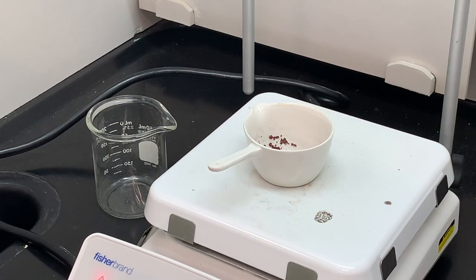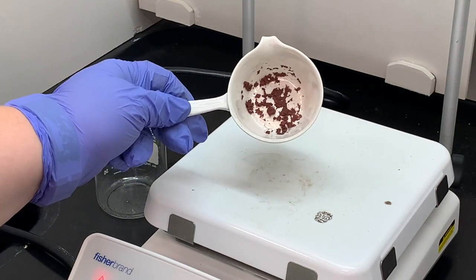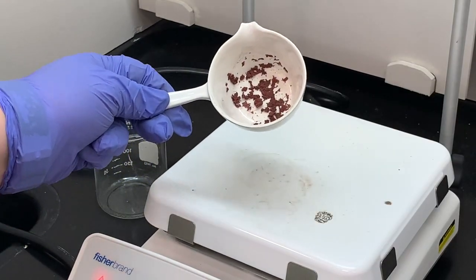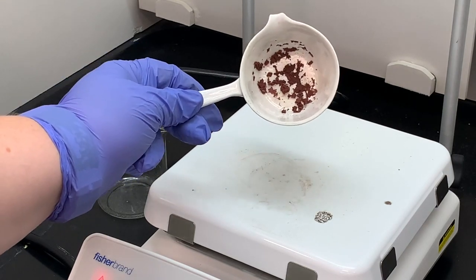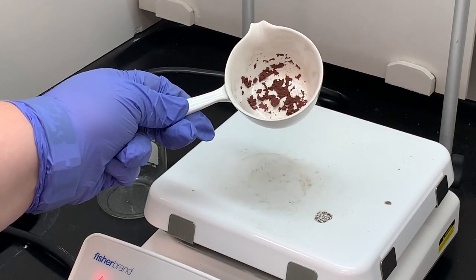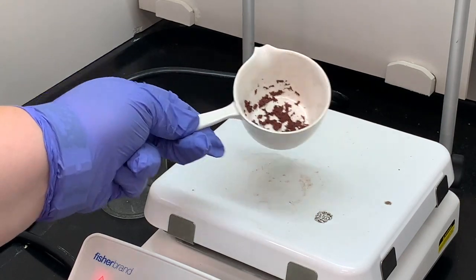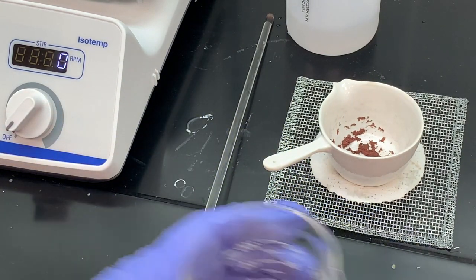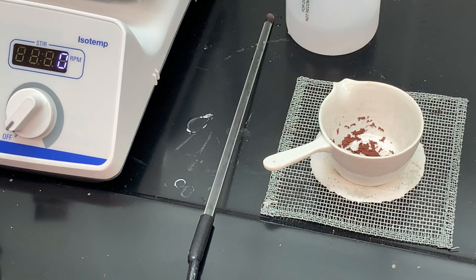There's still a good deal of condensation around the side, so I'm going to keep letting that heat up for a few more minutes, watching it so we don't burn the copper. Our copper is probably about as dry as it's going to get, so we're going to take it and put it on a piece of wire gauze to cool so we don't break our glassware. Your report sheet asks about the appearance of this copper — it's a brownish solid, pretty uniform. It doesn't look like the copper we started with, but it's still copper — just not in those shiny ringlets we started with.